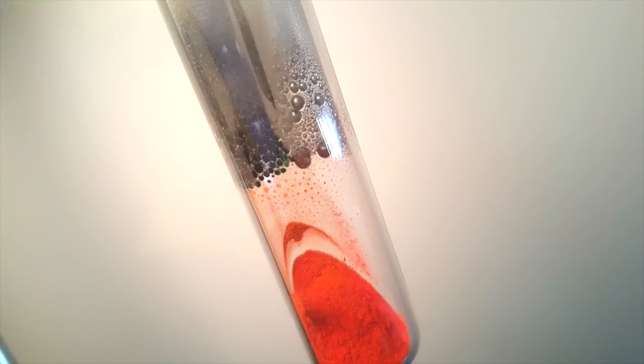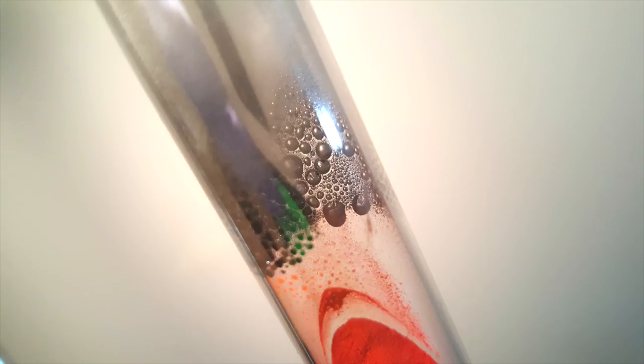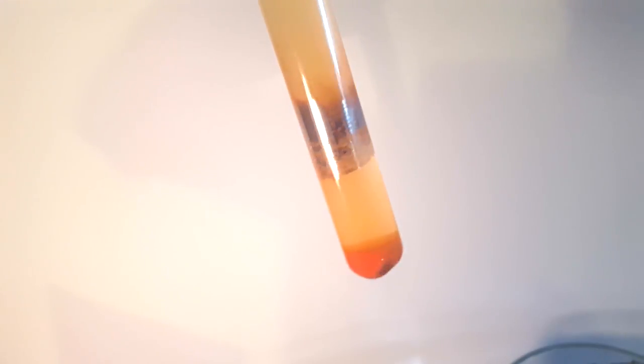When I was done testing the oxygen, I went back over to take some pictures of what I had left in the test tube. As you can see, there's some leftover mercuric oxide, as well as nice little balls of mercury on top. I actually tried recovering the mercury metal by washing everything with a bit of water, but I was unsuccessful and couldn't actually find the residual mercury at the bottom of the tube.